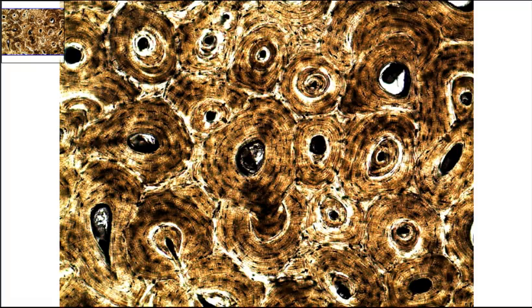If we zoom in a little bit, we can look at this one osteon, which is right in the center of our field of view. In an osteon, you have several features. First off, we need to look at the cells — these little black dots forming a ring shape. Each black dot is going to be an osteocyte, which is a cell inside of a lacuna, which is a space.